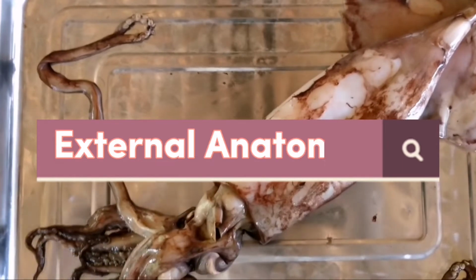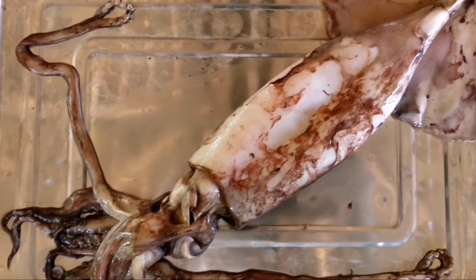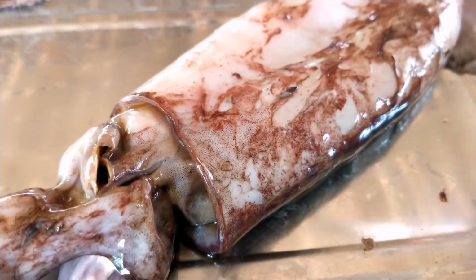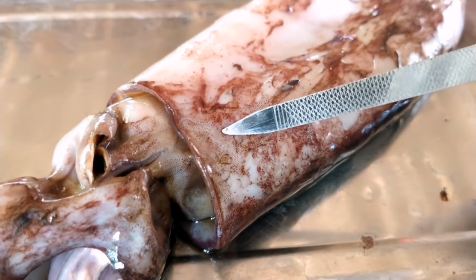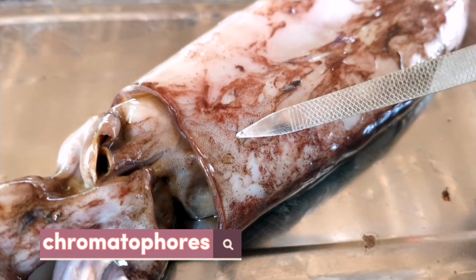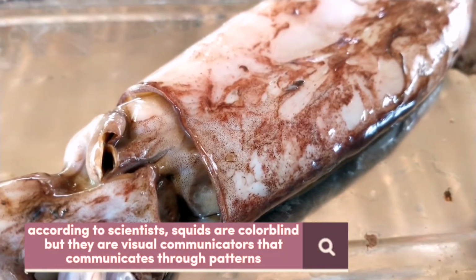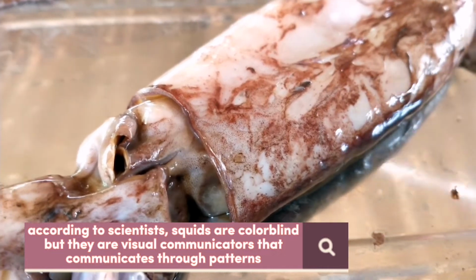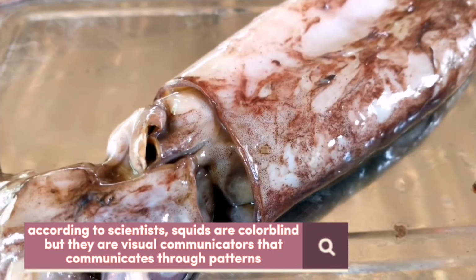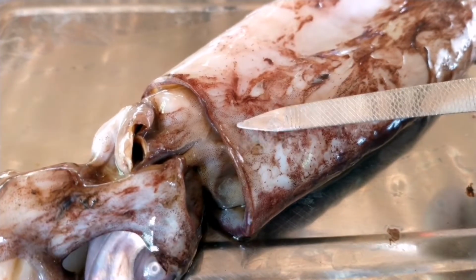Now let's take a look at this squid's external anatomy. One of the most remarkable things about squids is their skin. As you can see, there are a lot of visible colored dots which are called chromatophores, which are specialized pigment cells that can change color. Interesting fact about squids is they can not only change color but they can also form patterns, which serves as a form of communication between other squids.